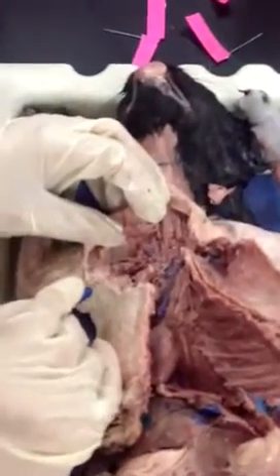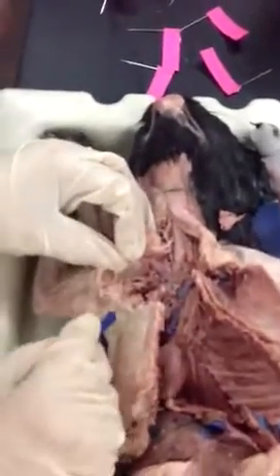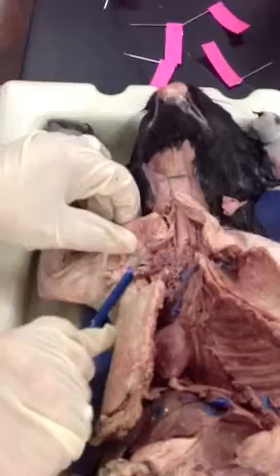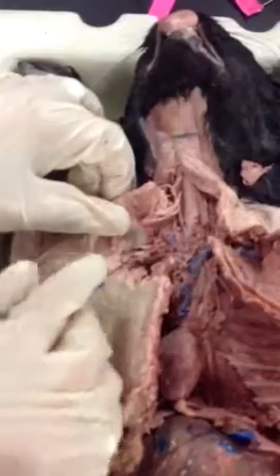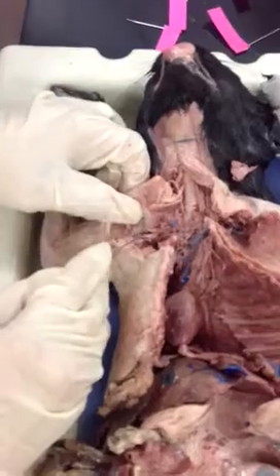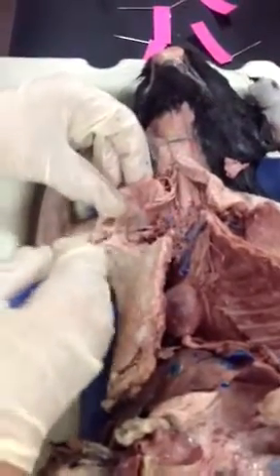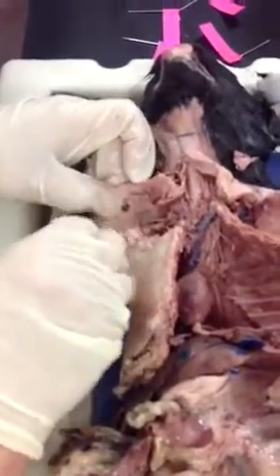Now, remember that we said that this right subclavian, once it goes into the armpit, is called what? Axillary. Very good. The way that you know that you're in the armpit is that you draw an imaginary line. You see it? Then I know that I'm in the axillary artery. Now, remember the analogy that I gave you about street names, right? This axillary, once it goes into the arm, is the brachial, exactly. You just have to continue dissecting and separating it with the probe so you can see it better.